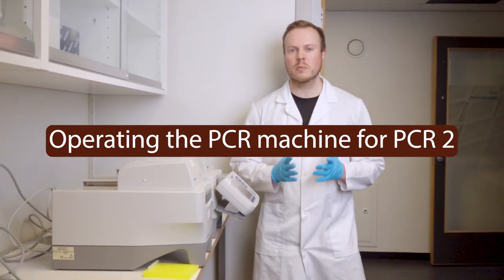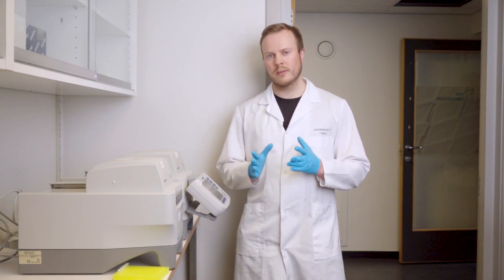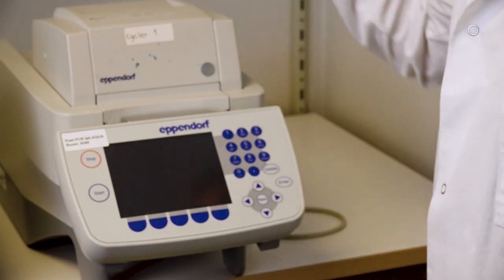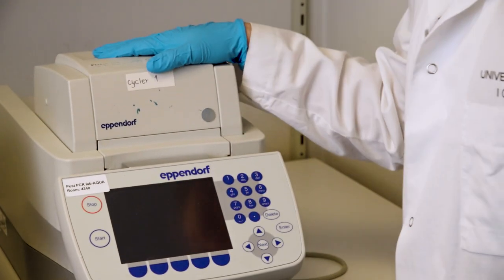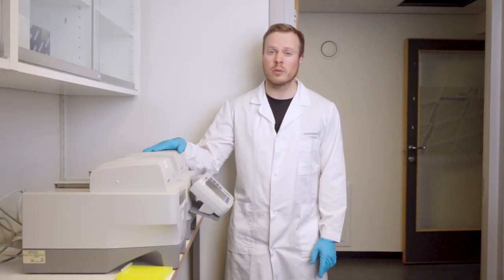Now we have performed the pipetting of our samples and prepared the PCR2. We are going to run the PCR2 program on the PCR machines. This is very similar to the last time we did this.